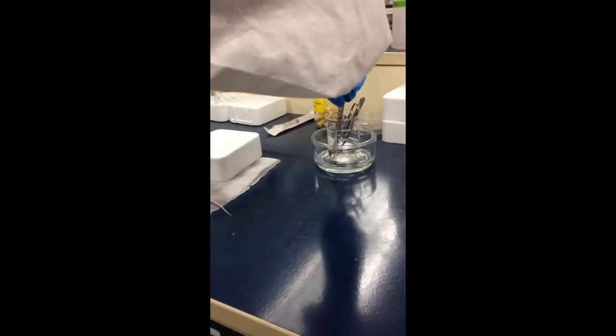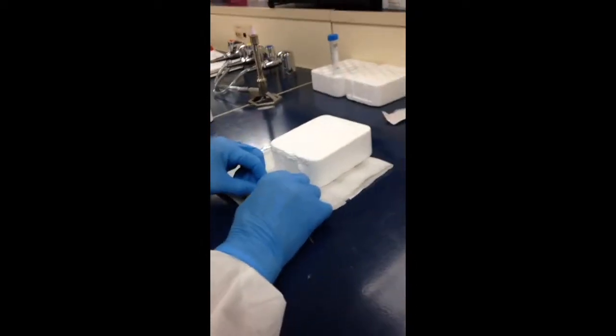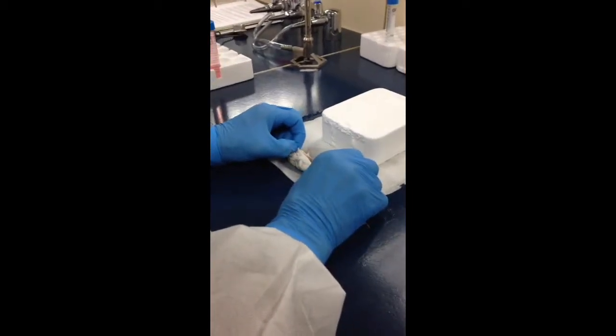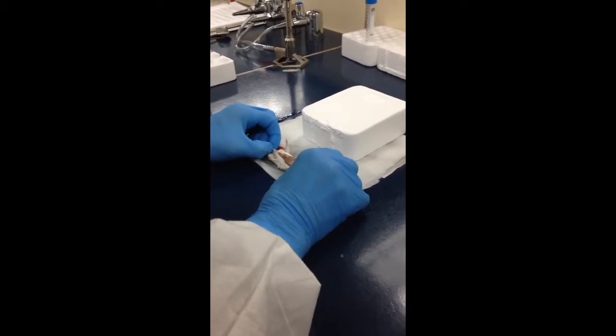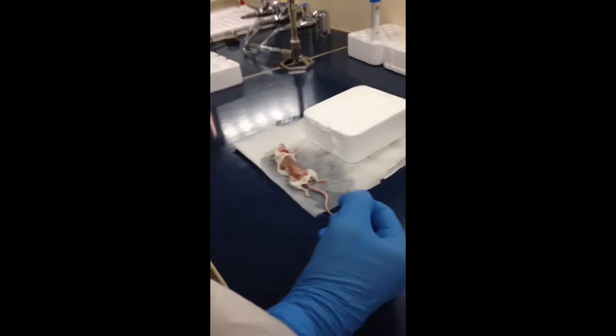Always make sure there's no flame on this when you put this away. And then I'm going to peel this little mouse like a grape. Essentially what I'm going to do is grab below that incision, grab above that incision, and just pull the skin away just like that. And now the whole peritoneum has been exposed.